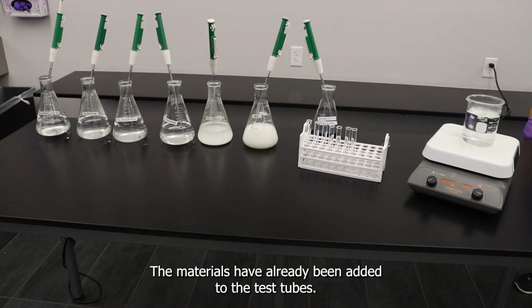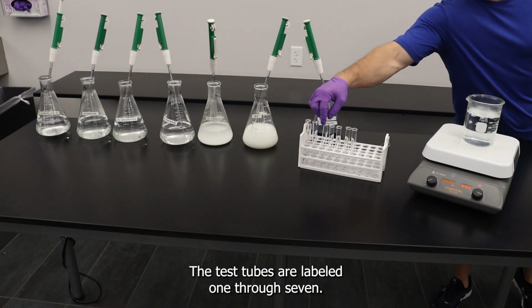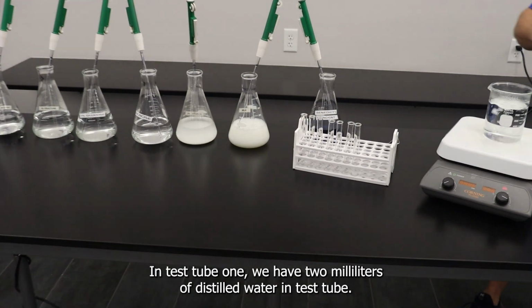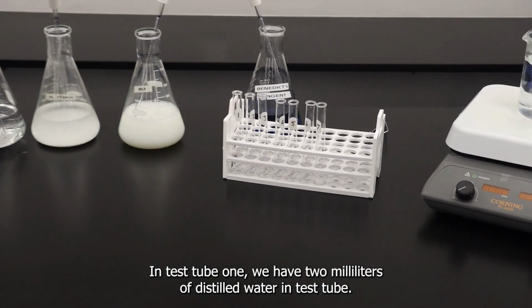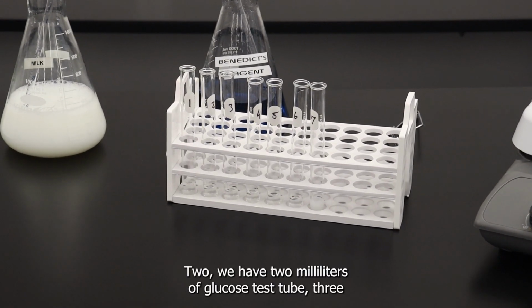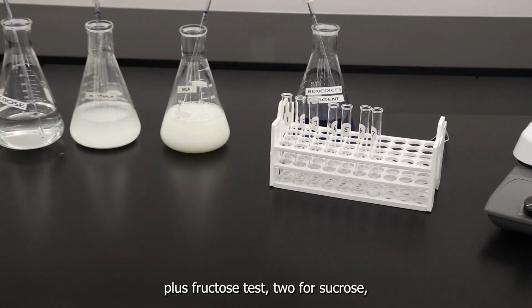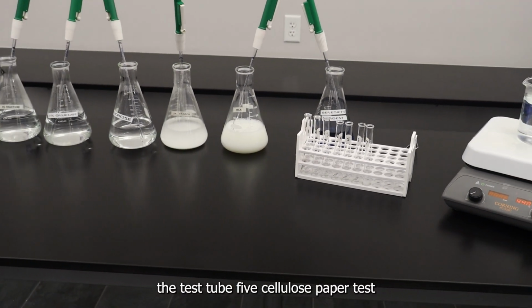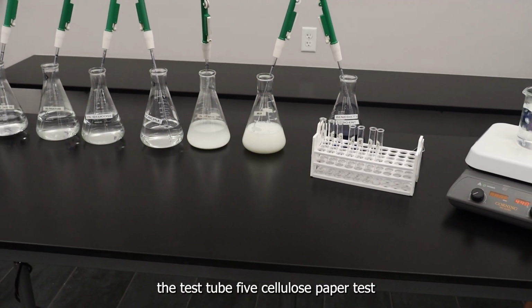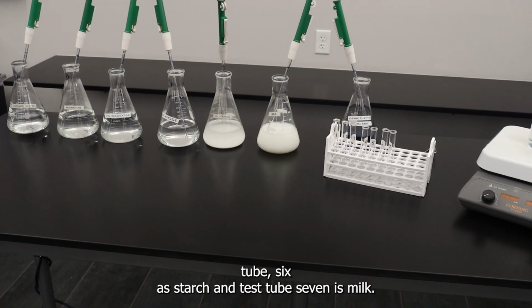The materials have already been added to the test tubes. The test tubes are labeled 1 through 7. In test tube 1, we have 2 milliliters of distilled water. In test tube 2, we have 2 milliliters of glucose. Test tube 3 has fructose. Test tube 4, sucrose. Test tube 5 is cellulose paper. Test tube 6 is starch. And test tube 7 is milk.